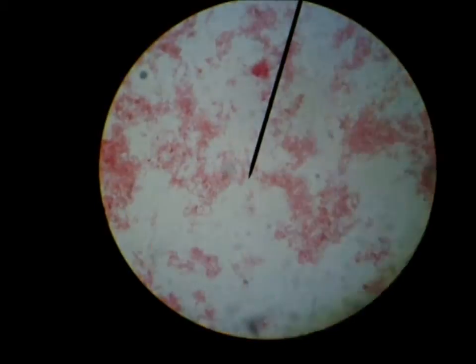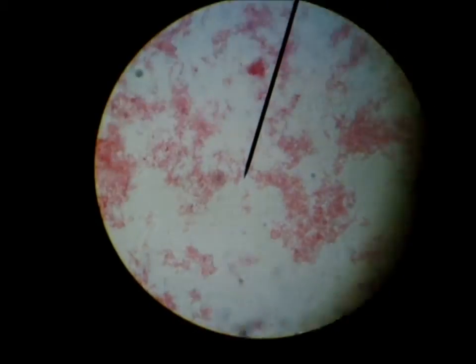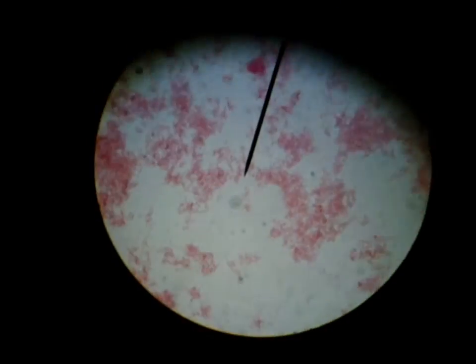This is pink so it's gram negative, and there are little corkscrew shapes, so this is spirilla.